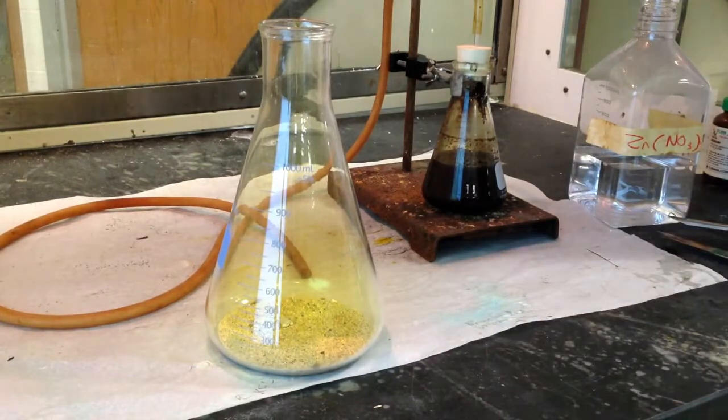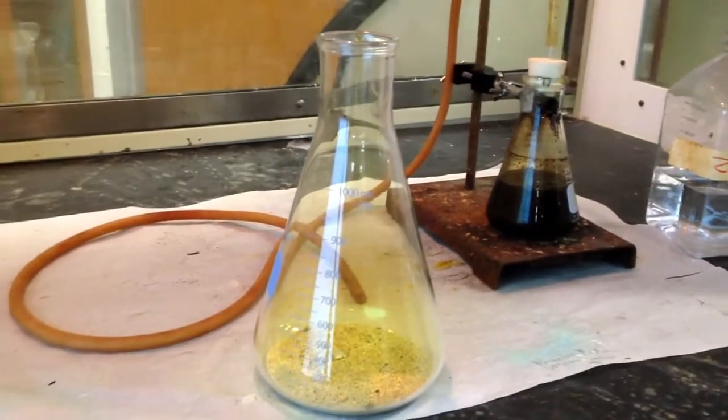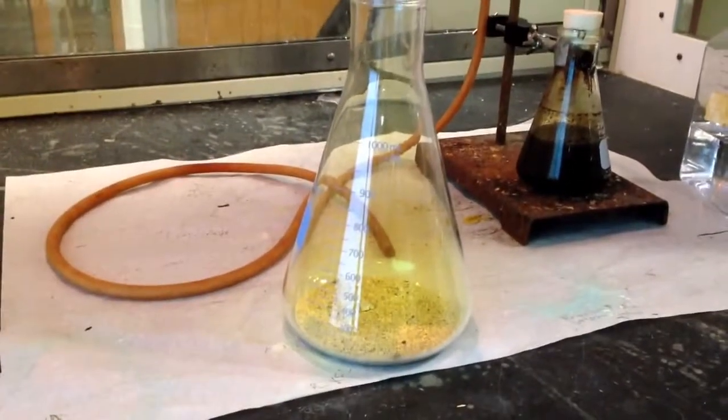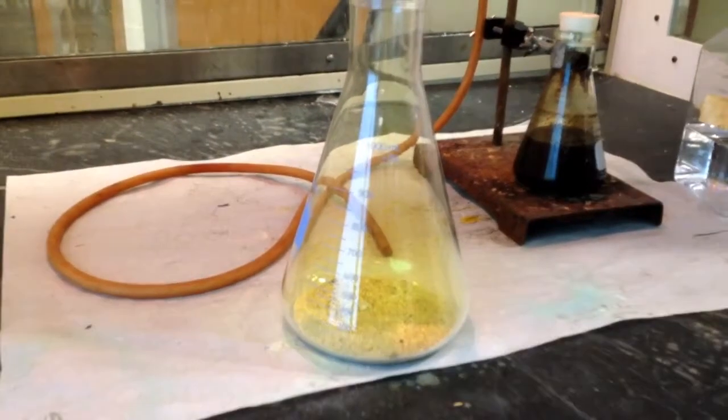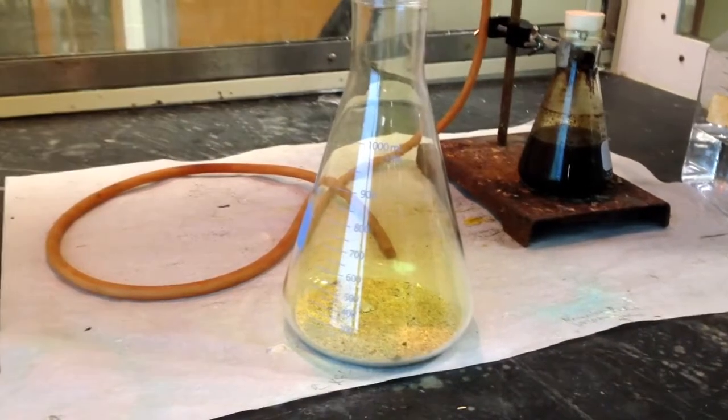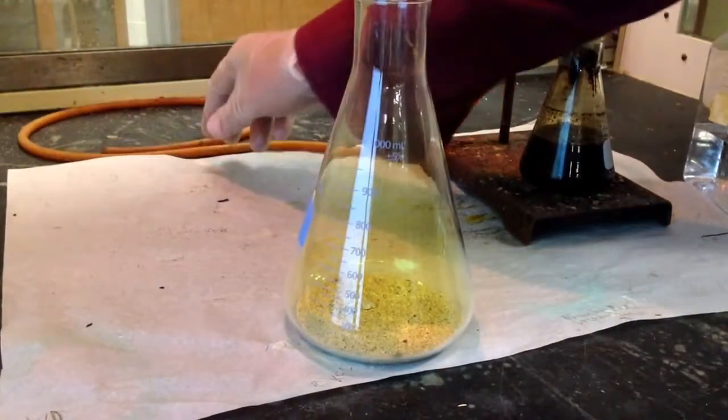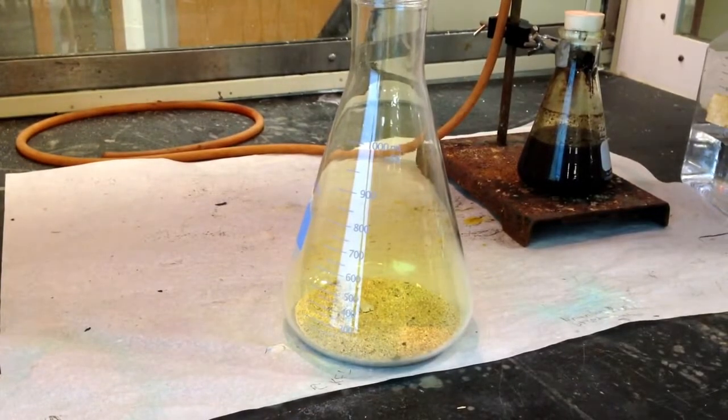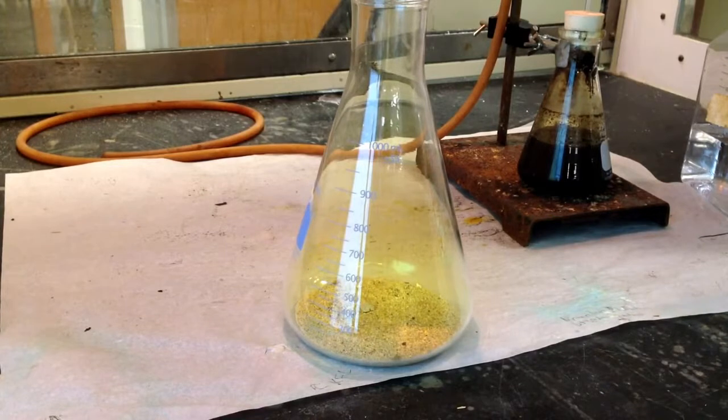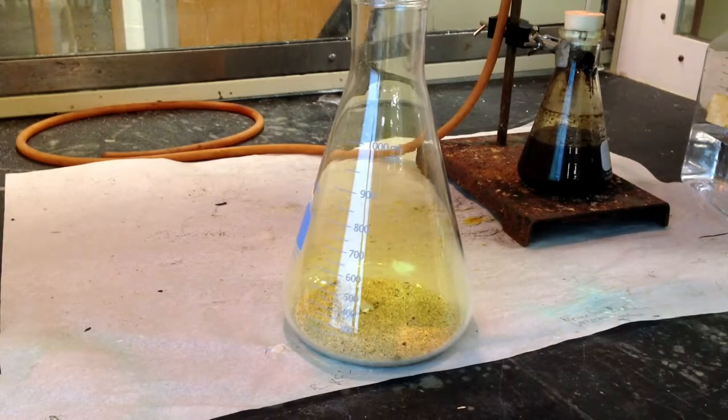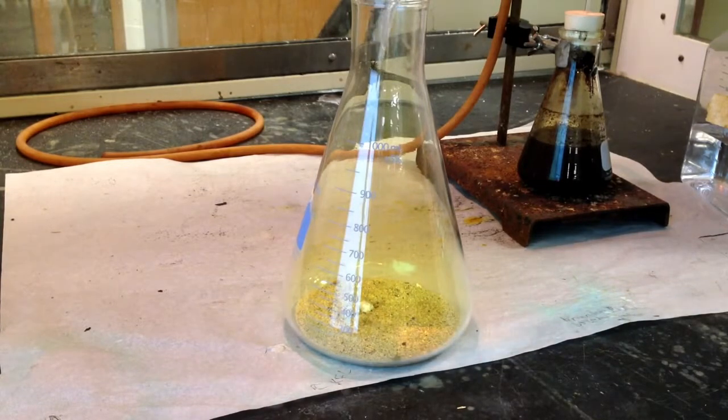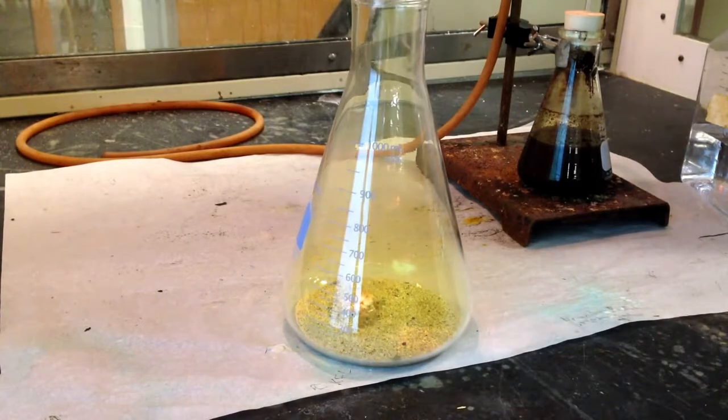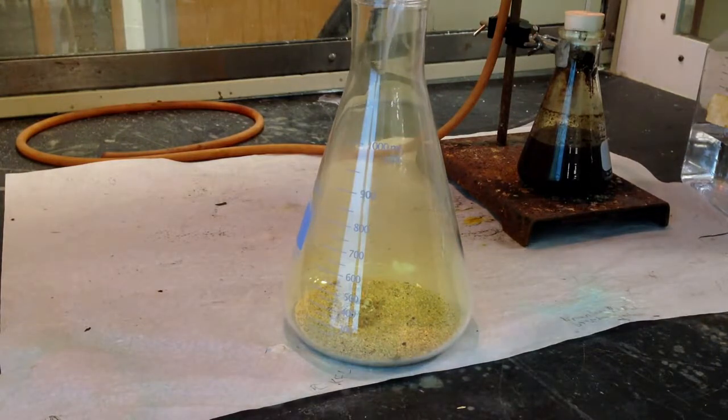Now, let's see if we've got a nice little close-up here of what's going on. And refocus. And what we're going to do is I'm going to drop some water on this sodium metal to activate it. And we should see a pretty brilliant reaction once I activate it. So I'm just trying to drop some water with a pipette to start the reaction. And there it is.